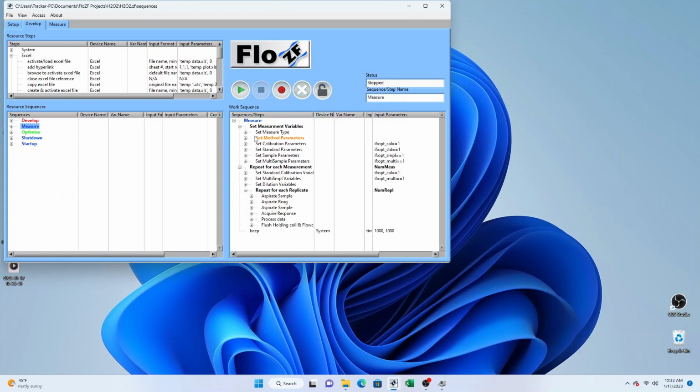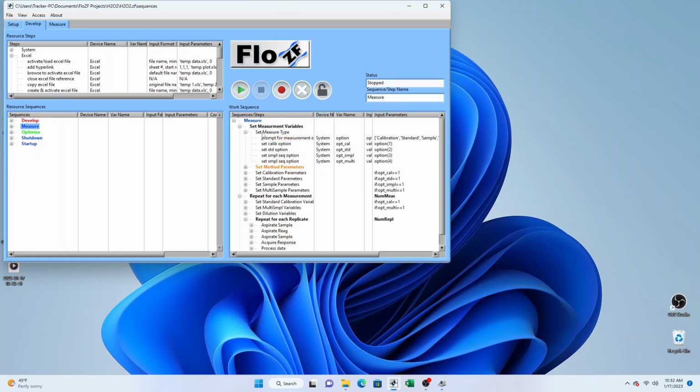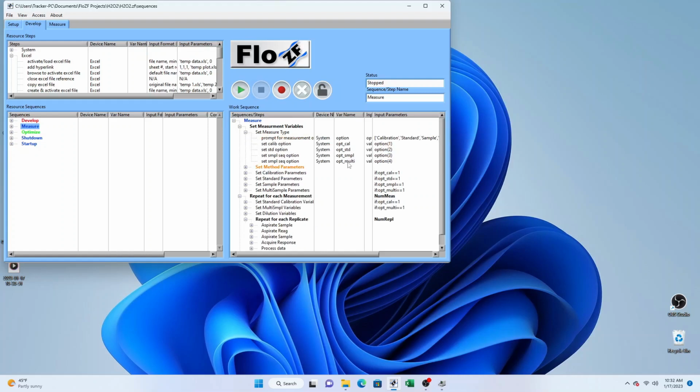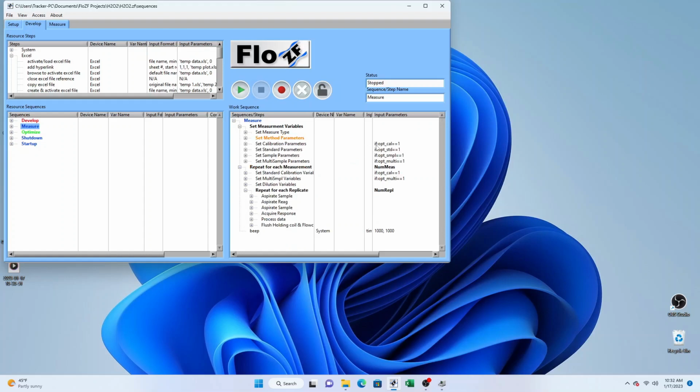That shows how the case statement works, and the case statement is set up in this set measurement type subsequence. Various options are presented, and then variables are assigned a value of 1 or 0 depending on whether that particular option was selected. Once each of these option variables has a value, we can use those to set up conditions for a particular set of measurements. So if opt_cal is set to 1, then when we get down to the next one, if opt_cal is equal to 1, then this subsequence will be carried out, and the same for each one: opt standard, opt sample, and opt multi-sampler.